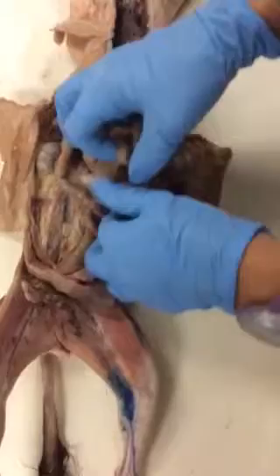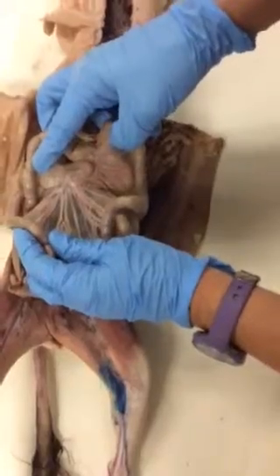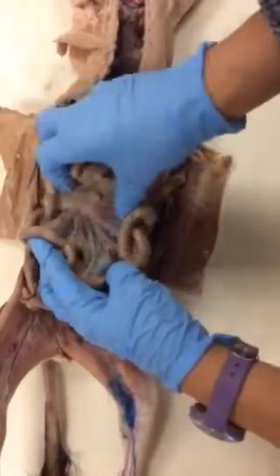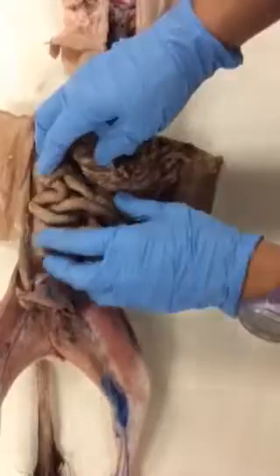What I've not mentioned is the blood supply, the arteries and veins, and the nerves for the small intestine. They are located here within the proper mesentery, which is very nicely visible, and which is also part of the peritoneal tissue parts.